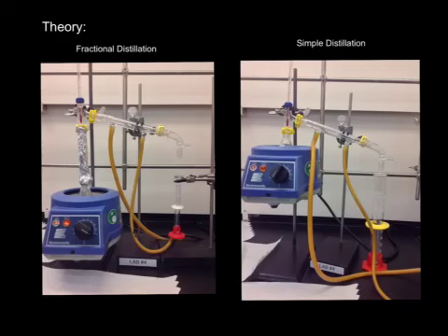The ability to separate two mixtures based on their difference in volatility is the basic idea behind distillation. When two liquids mix, the more volatile liquid, in this case ethanol, will have a higher vapor pressure. The vapor will then condense back into its liquid form, separating the mixtures. As distillation is repeated on the distillate, the concentration of the more volatile substance becomes greater. On your right, you see simple distillation, which allows for only one cycle or theoretical plate to occur, but it's quicker.